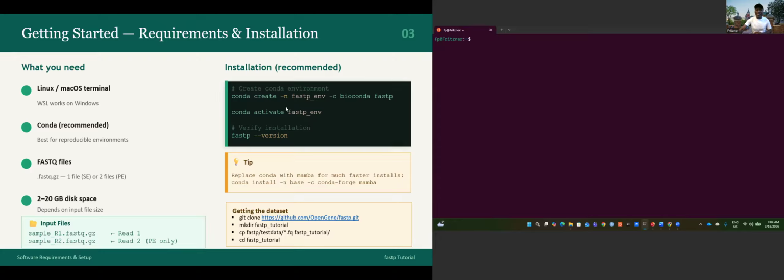Before getting started, let me teach you how to use Conda to install fastp first of all. There are several ways you can install fastp. There is an official GitHub page where you can get the binary version of fastp. You can also use sudo apt in the command line, but that requires admin credentials, which is not good for reproducibility. For reproducibility, I do recommend Conda, because with Conda you can share your code with anybody. What you need to do is just install the environment. You don't need any admin credentials to use the Conda environment.